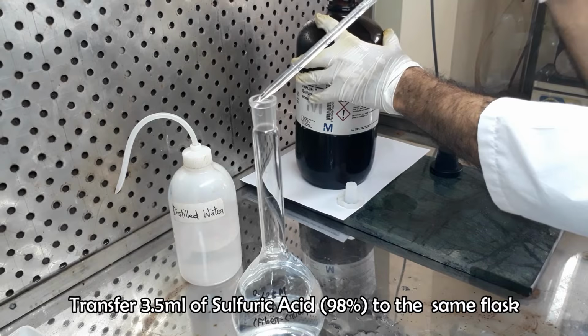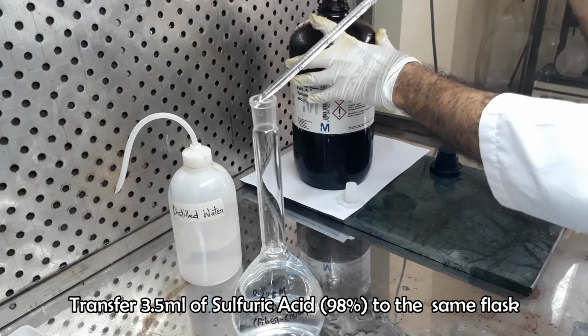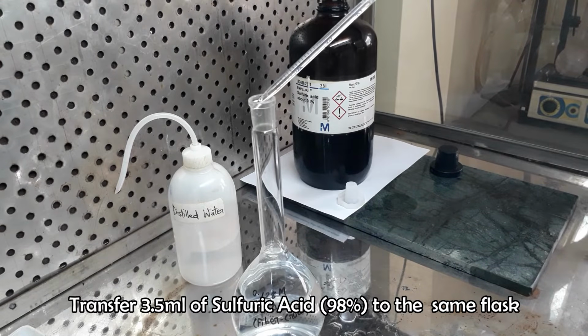Carefully add 3.5 milliliters of 98% concentrated sulfuric acid and wash the pipette to ensure that no residue of sulfuric acid is left on the inner surface of the pipette to transfer into the flask.